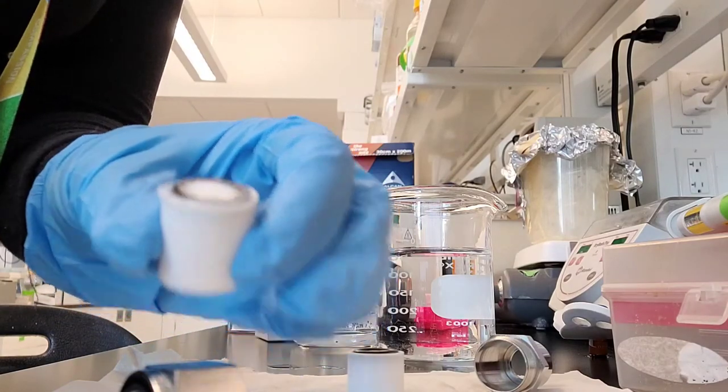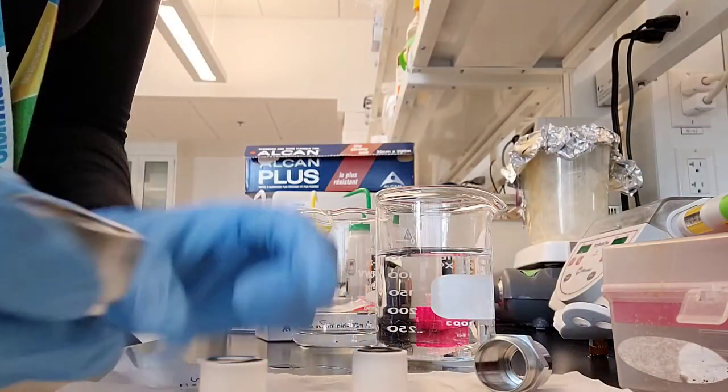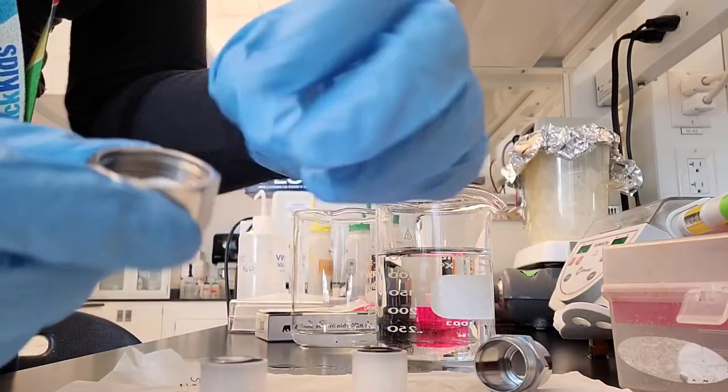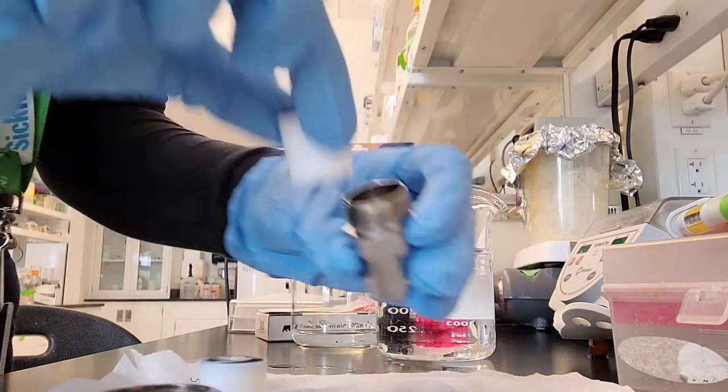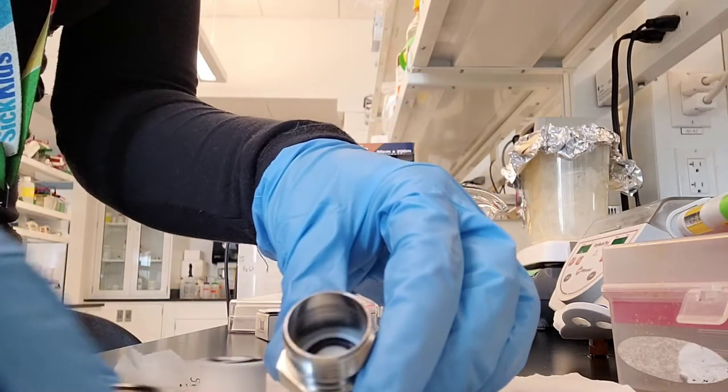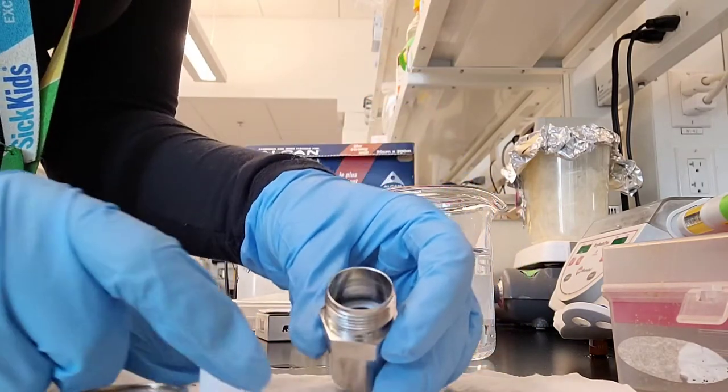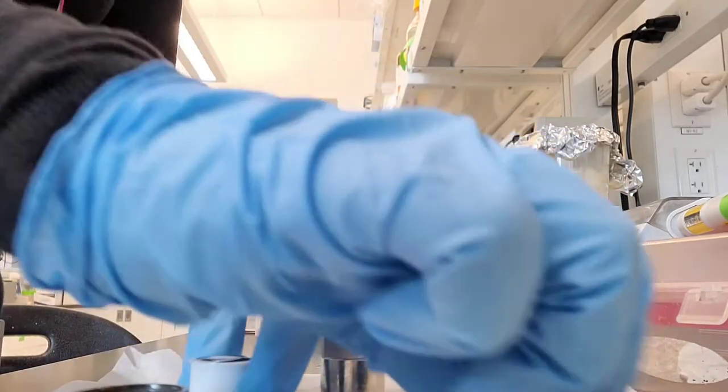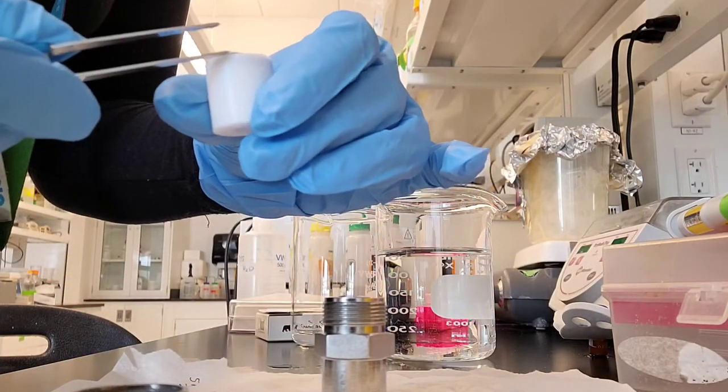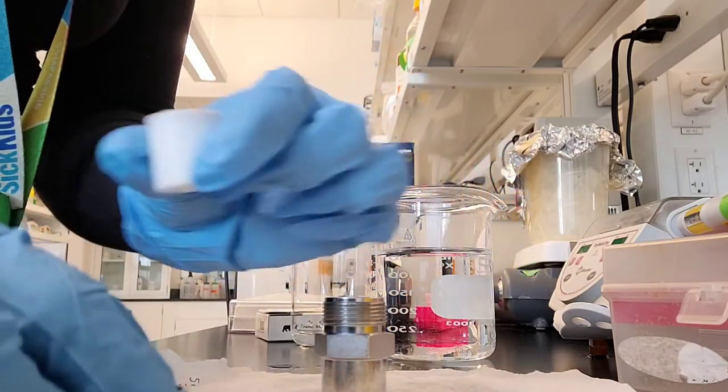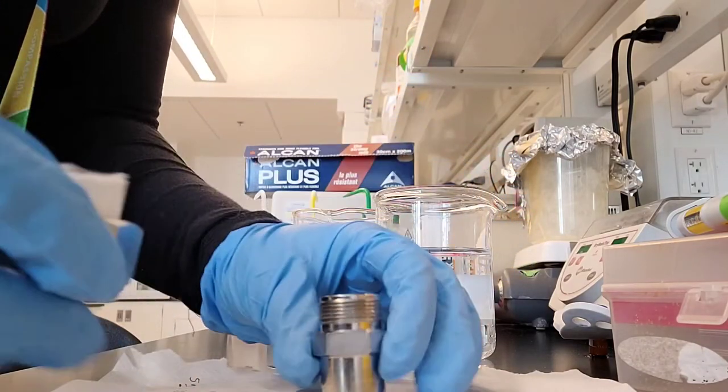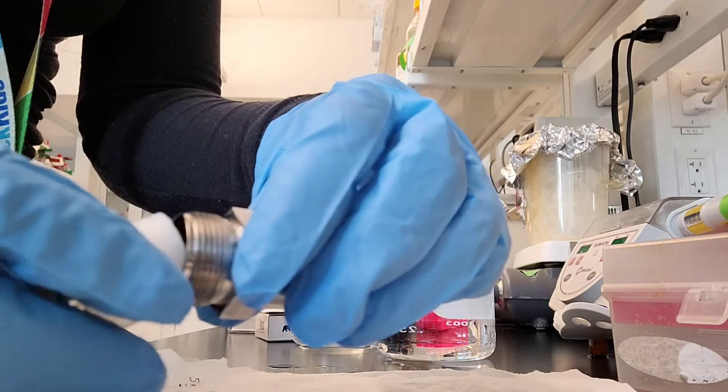I put the two small filters on each of those white parts and then put the big filter in the middle. I assemble everything making sure that the big filter is in the middle of the two small ones.